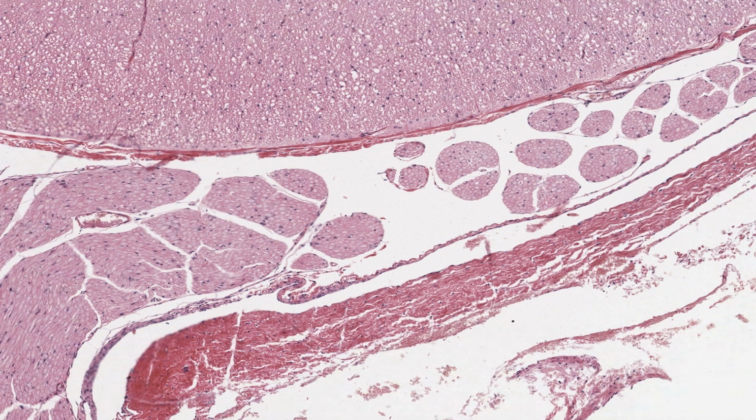This section of the spinal cord has well-preserved white matter as well as grey matter. Nonetheless, myelin sheaths have been extracted and the axons are considerably shriveled in the spinal cord. It's very hard to avoid this sort of artifact, which affects the large axons more than the little ones. Myelin is more easily preserved in the nerve rootlets than that within the white matter of the spinal cord.